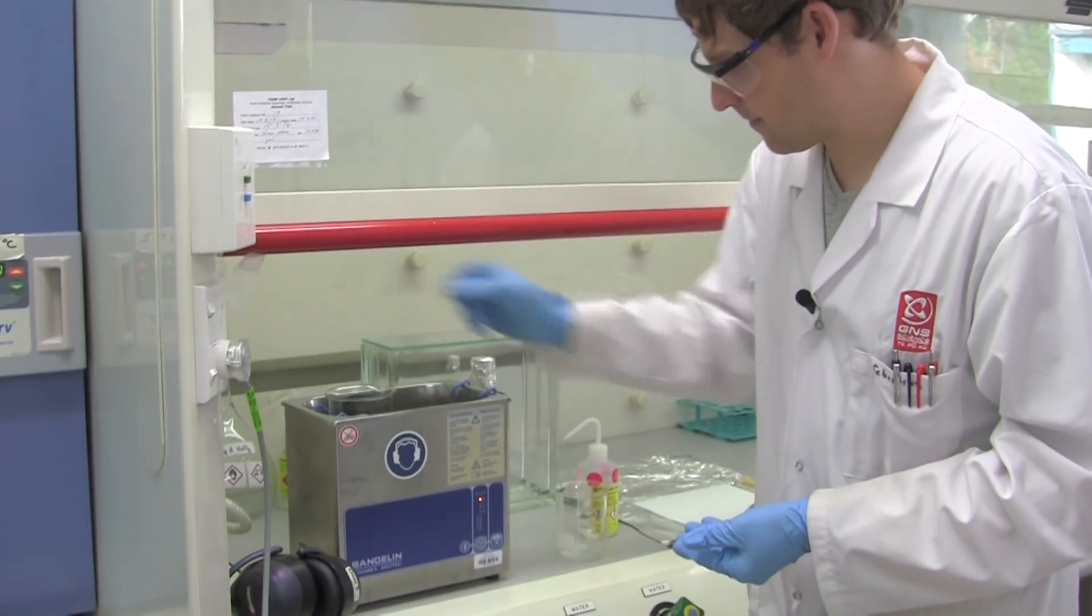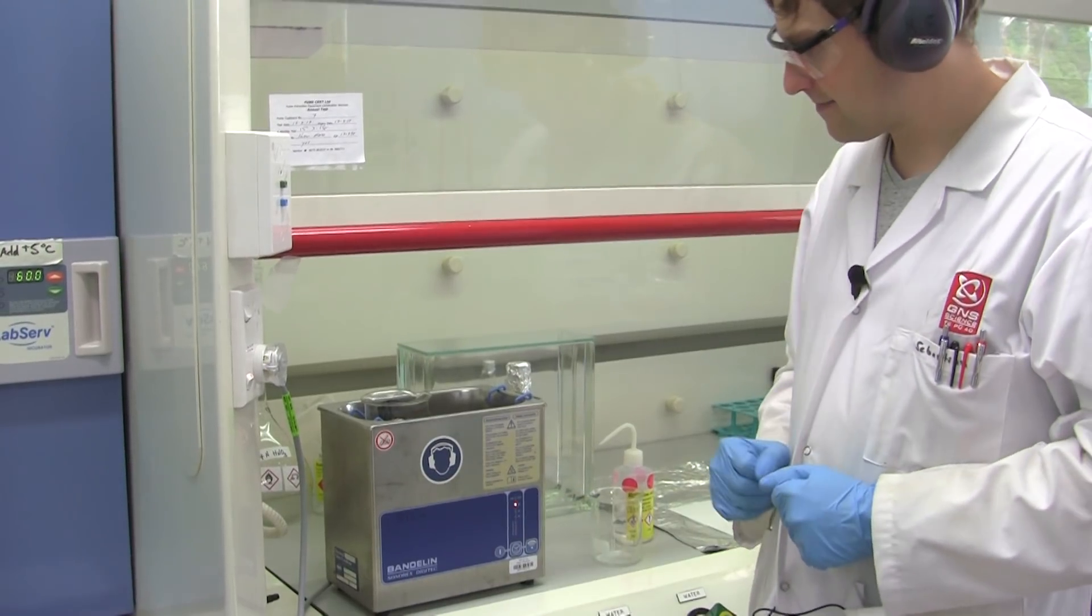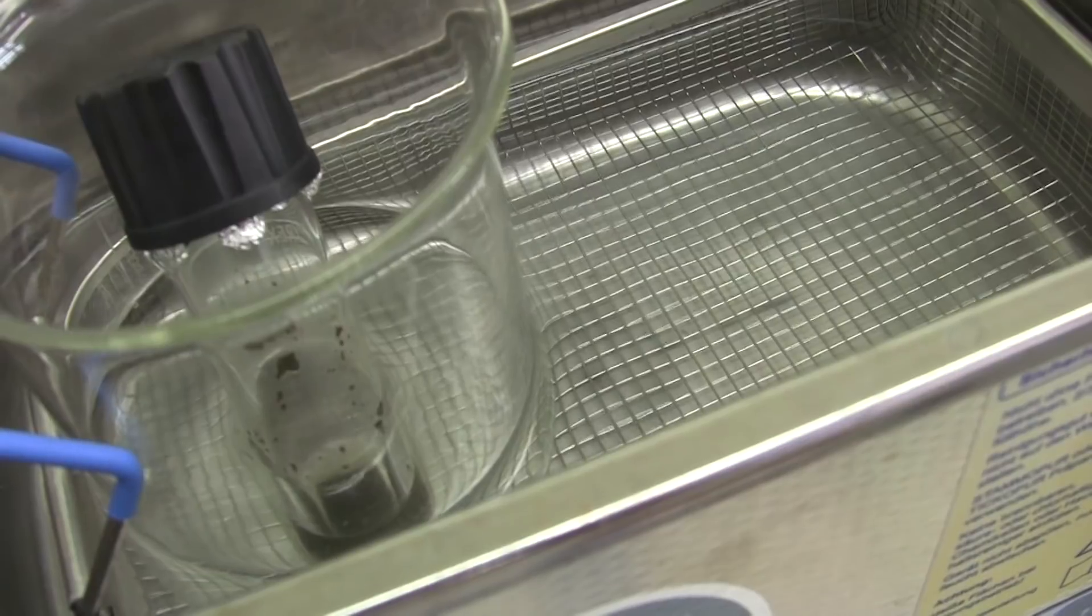In order to better dissolve our compounds of interest, our pigments, we can use ultrasound. So there's basically sound waves which help us to better dissolve the sample. And this is what we obtain as a result.